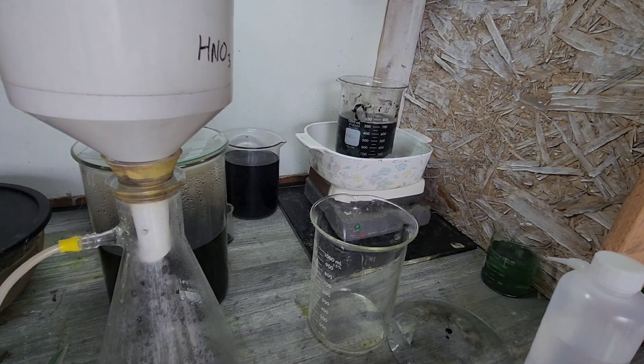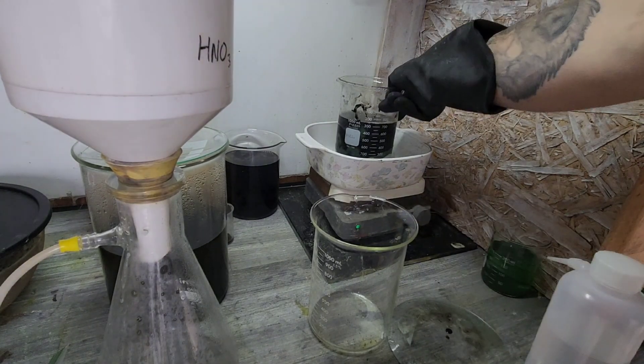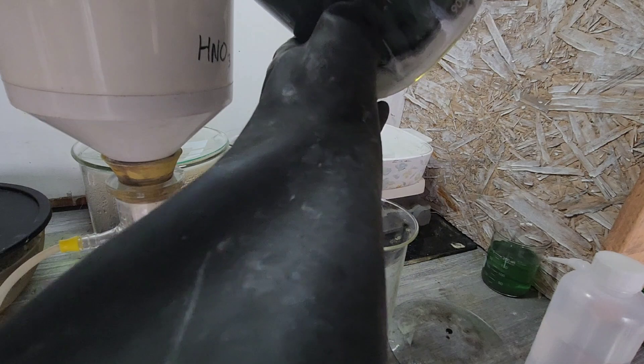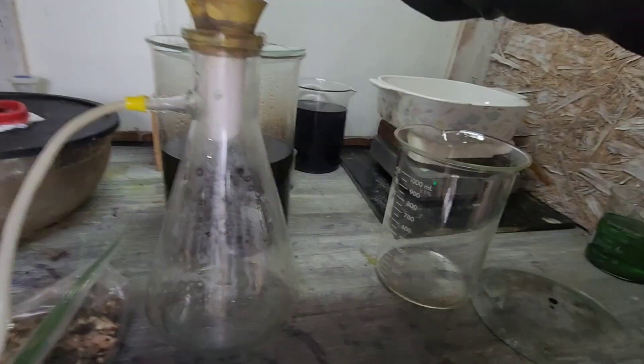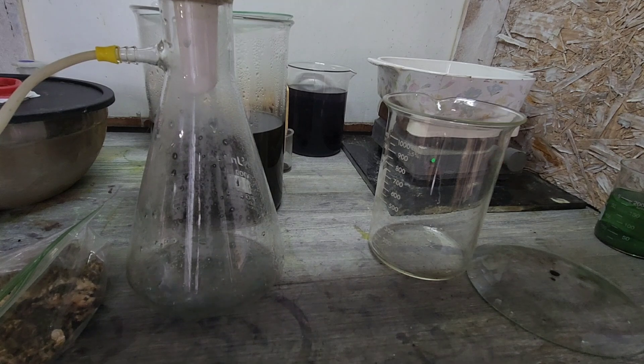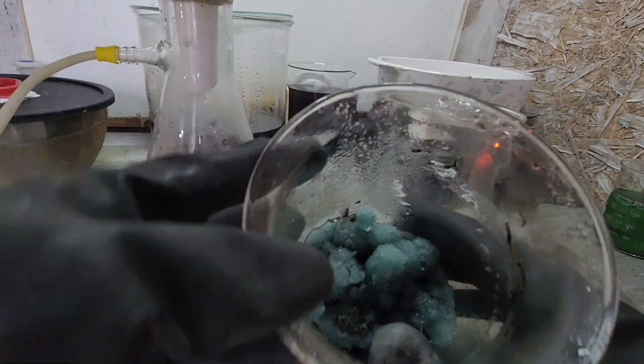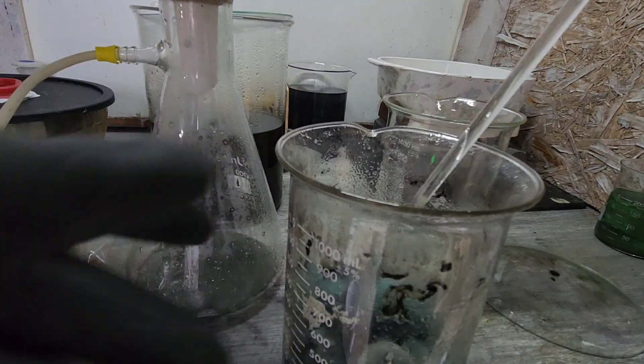All right, let's go ahead and filter our solution out here. I think I see some crystals forming on the inside of that already. Let me get my arms out of the way here. There we go, look at that, bunch of them in there. So I don't think I was fast enough.